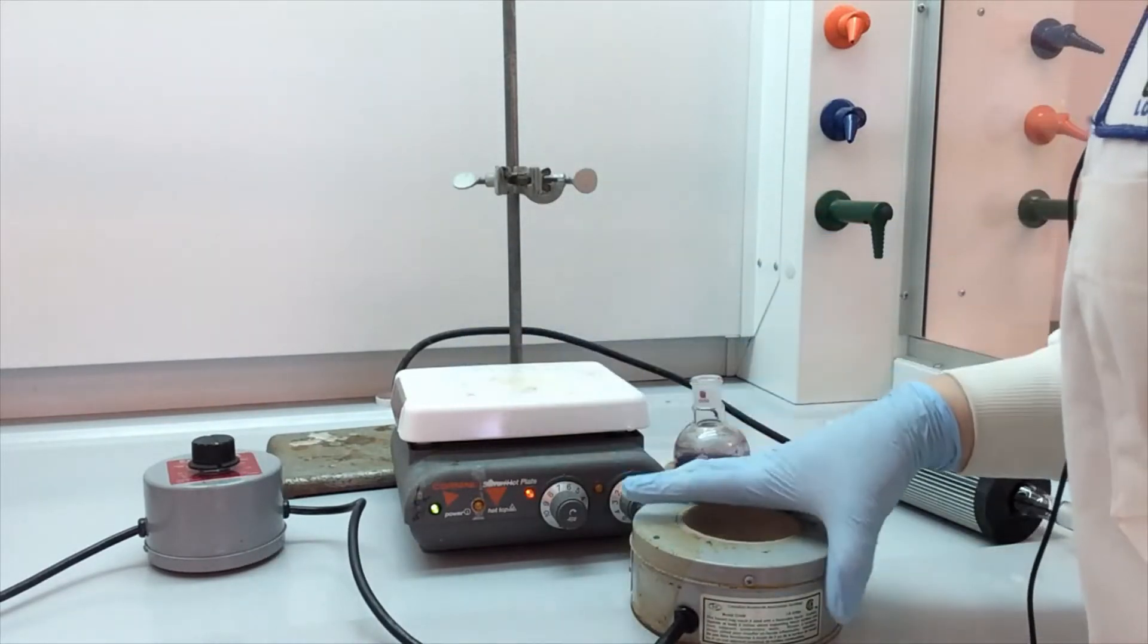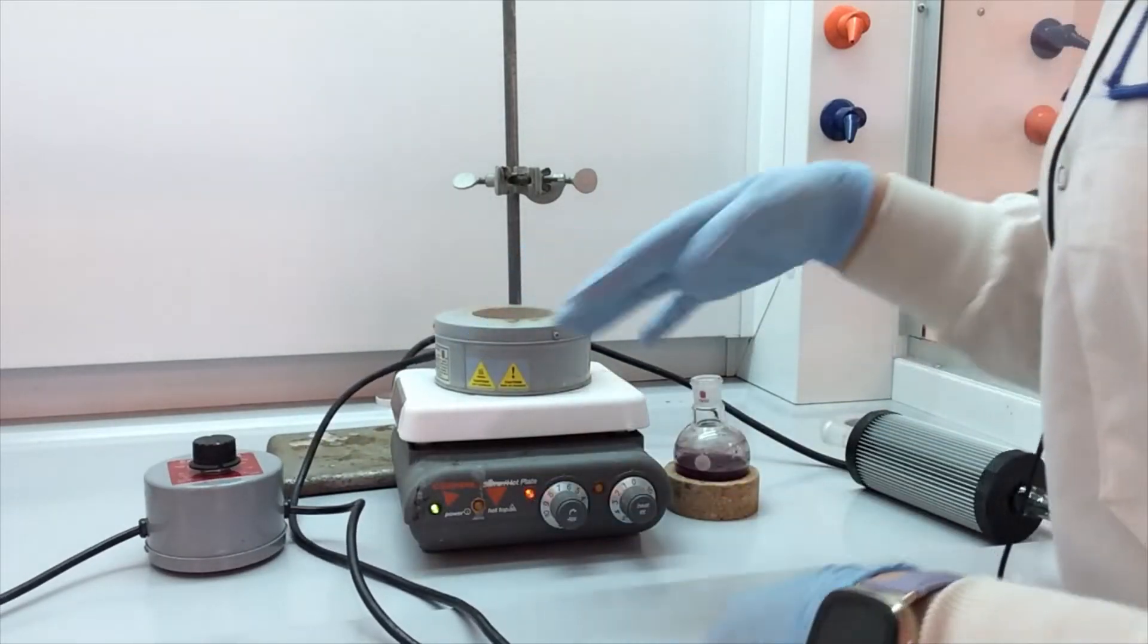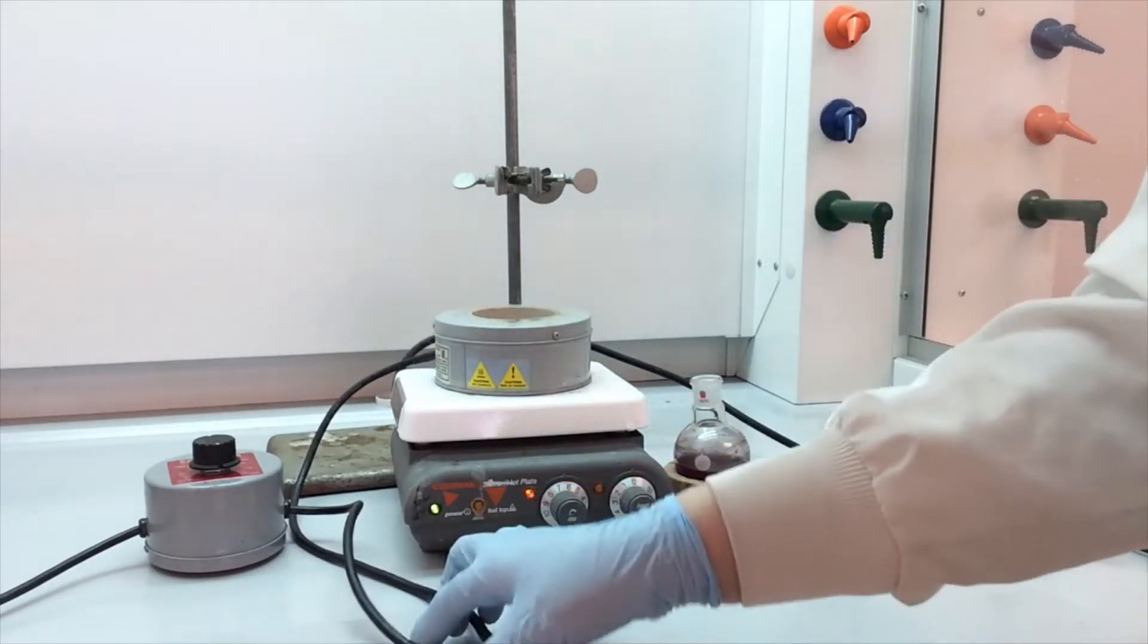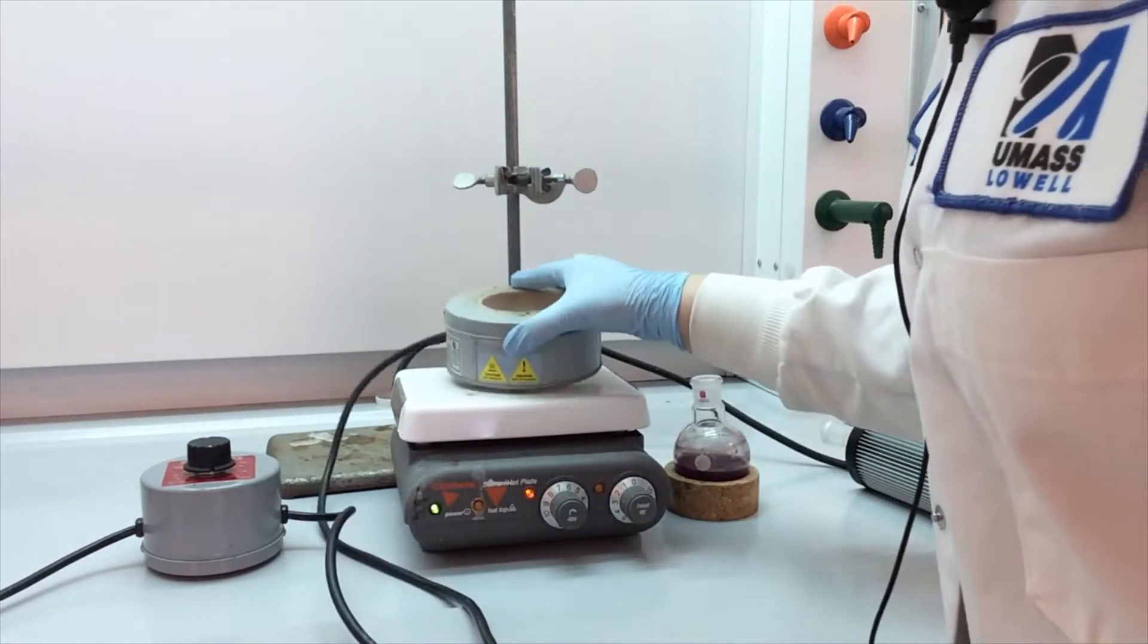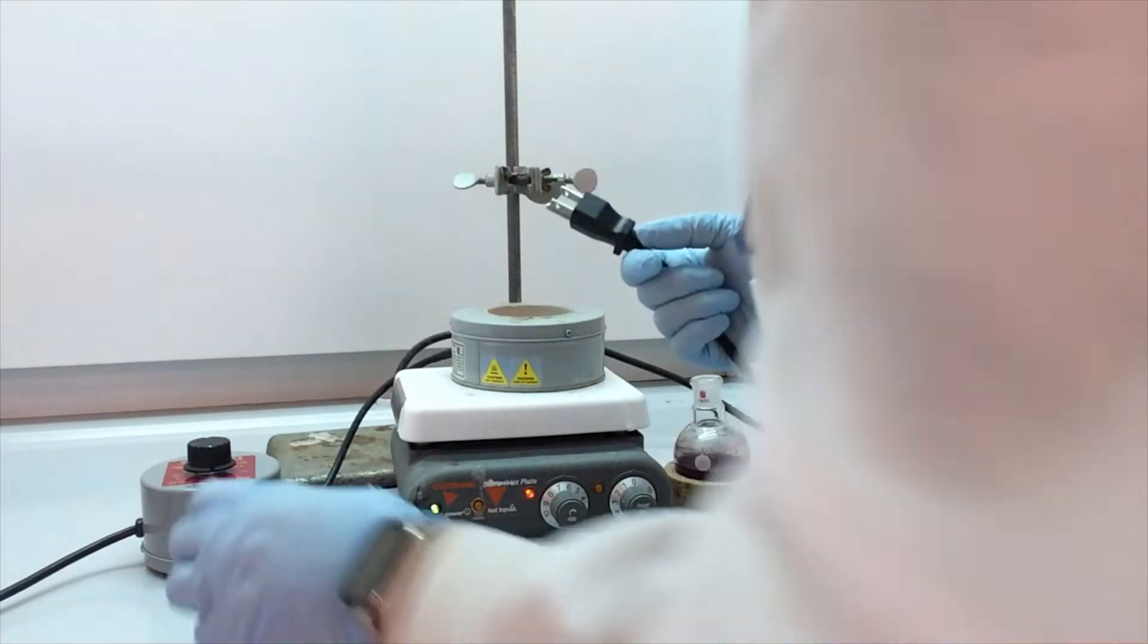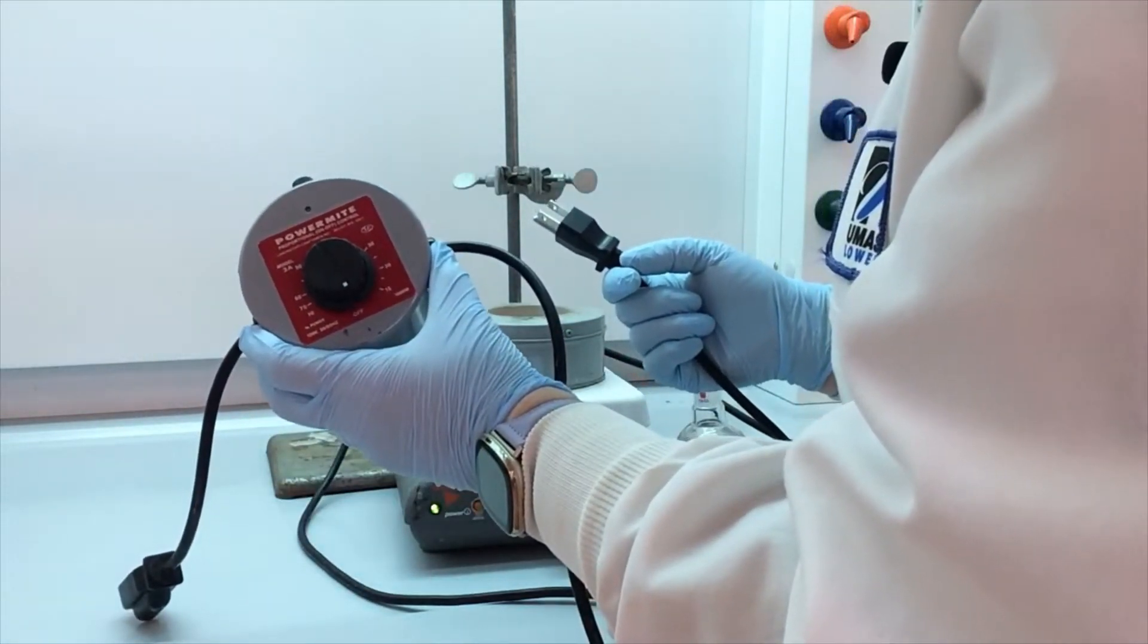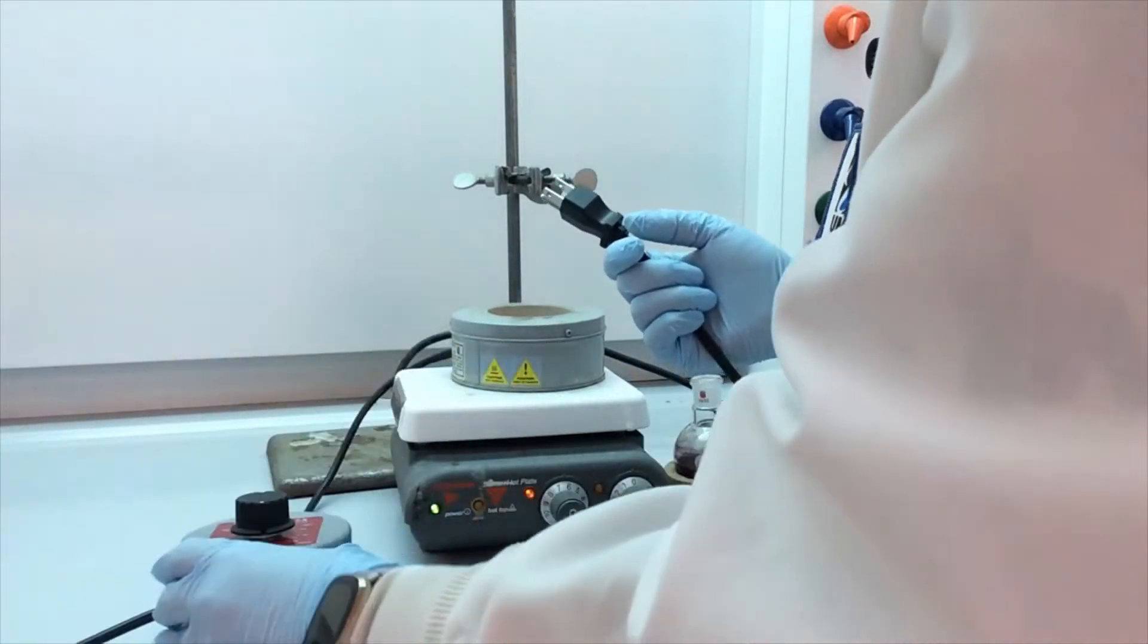We're going to set this on top of a stir plate. We need the stir plate just for the stirring capabilities. To control how hot this gets, you plug this now into the controller. This is the one that we have that's most common.